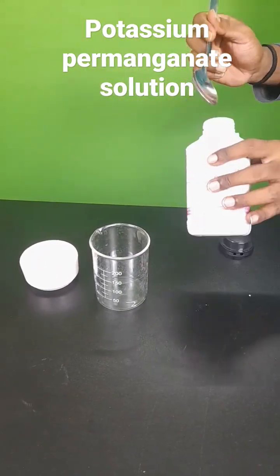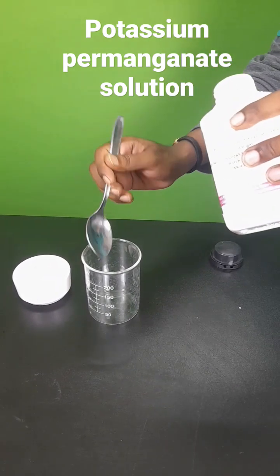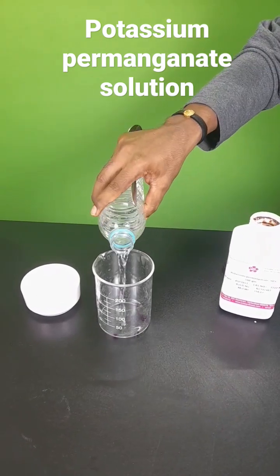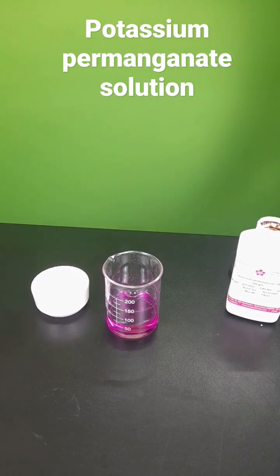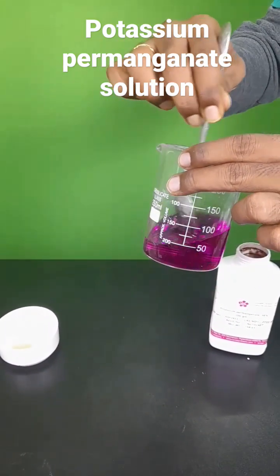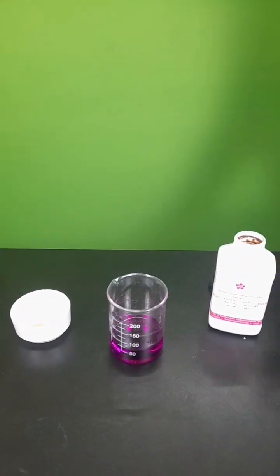I am taking this KMnO₄ into the glass beaker. A small amount of KMnO₄ I have taken into the glass beaker. Now I am making a KMnO₄ solution. You can observe the KMnO₄ color — a dark purple color solution. We made a dark purple color solution of KMnO₄.